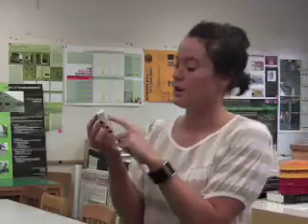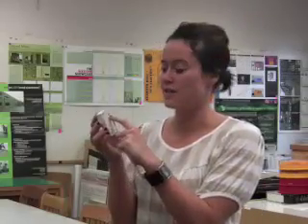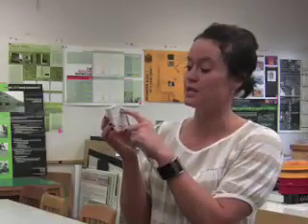Up on the top of the Hobo there's a barcode, and each one of the barcodes tells you where the Hobo should be returned to. The Baker lab has a different setting, and for the ones that come back to Allison Kwok's lab, it says AOC — Agents of Change.